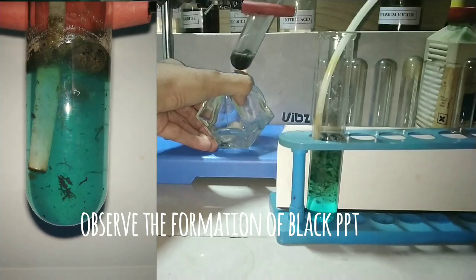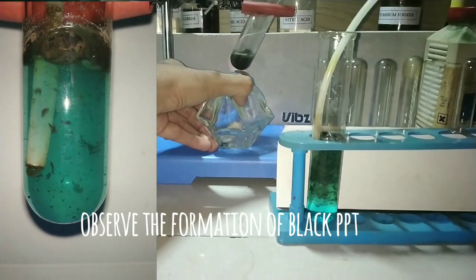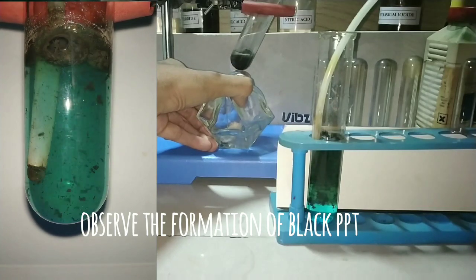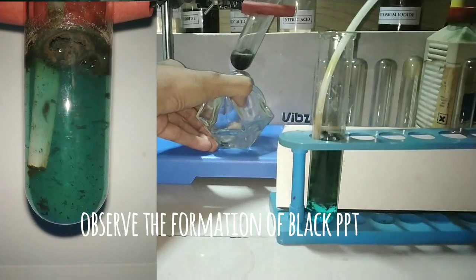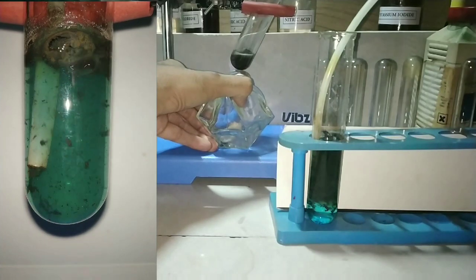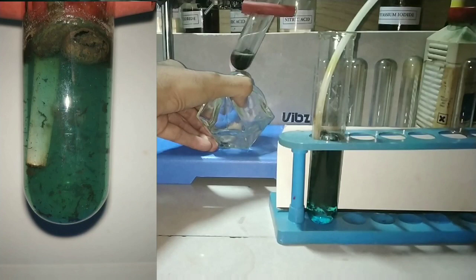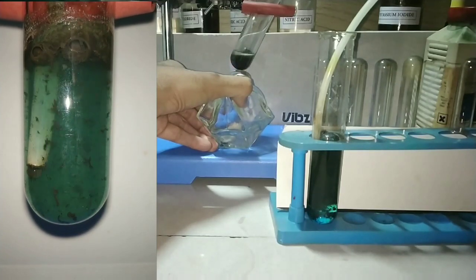You can see that on bubbling the hydrogen sulfide gas there is formation of a black precipitate. Now we have to differentiate this between lead and copper, but since we have already ruled out lead by adding the hydrochloric acid in the group 1 test, this black precipitate means that it is copper.